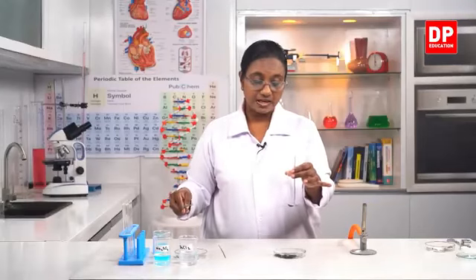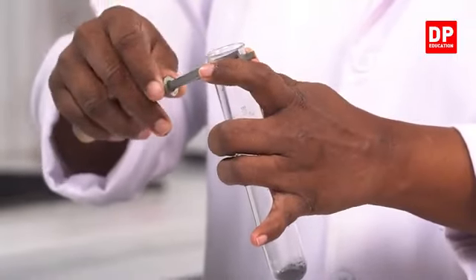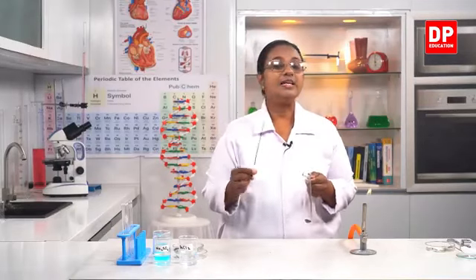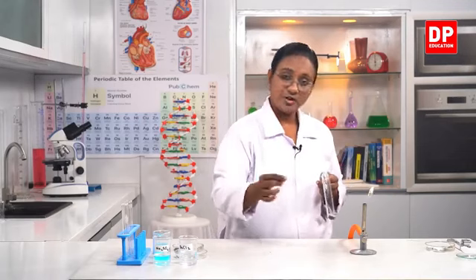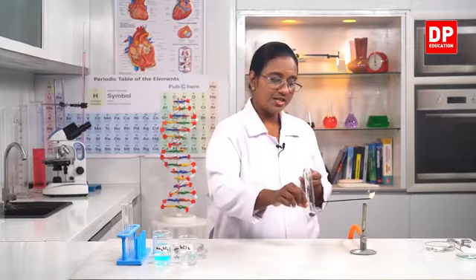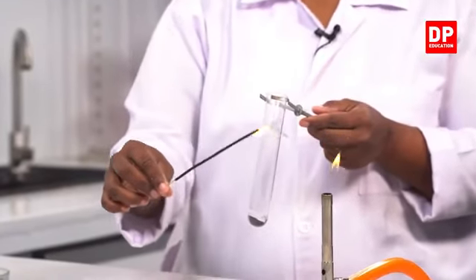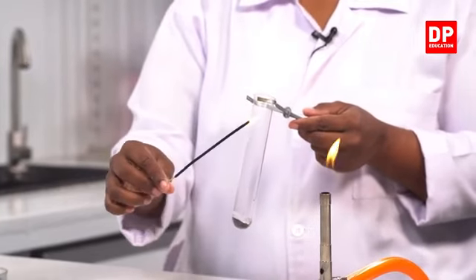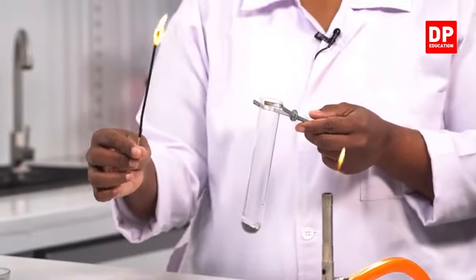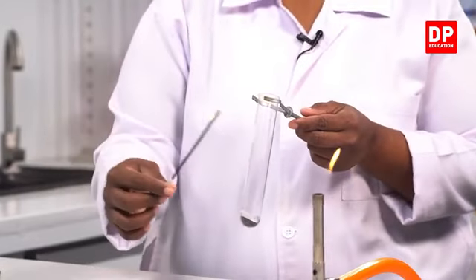So here I have taken potassium permanganate crystals. Here, students, for a glowing splinter, I will use a joss stick. Incense stick, you all know. Then it would be easy for us to observe the change. You all know what a glowing splinter is. There should be no flame, only the glowing part has to be there. The splinter has to have the glowing burning part but without a flame.